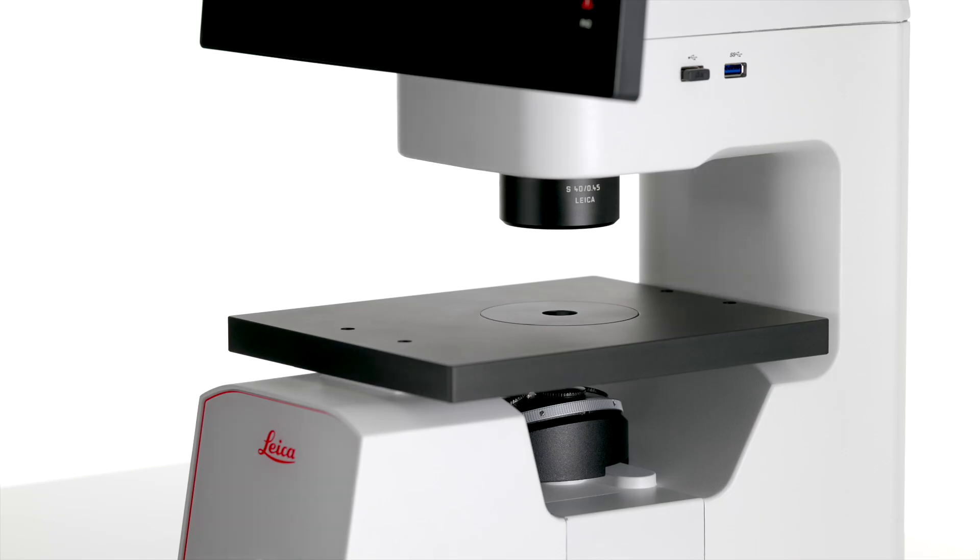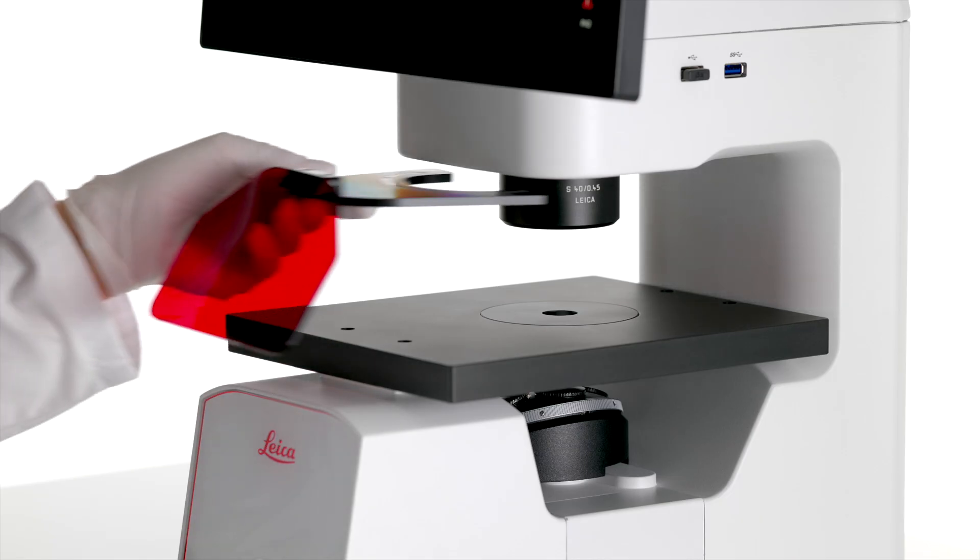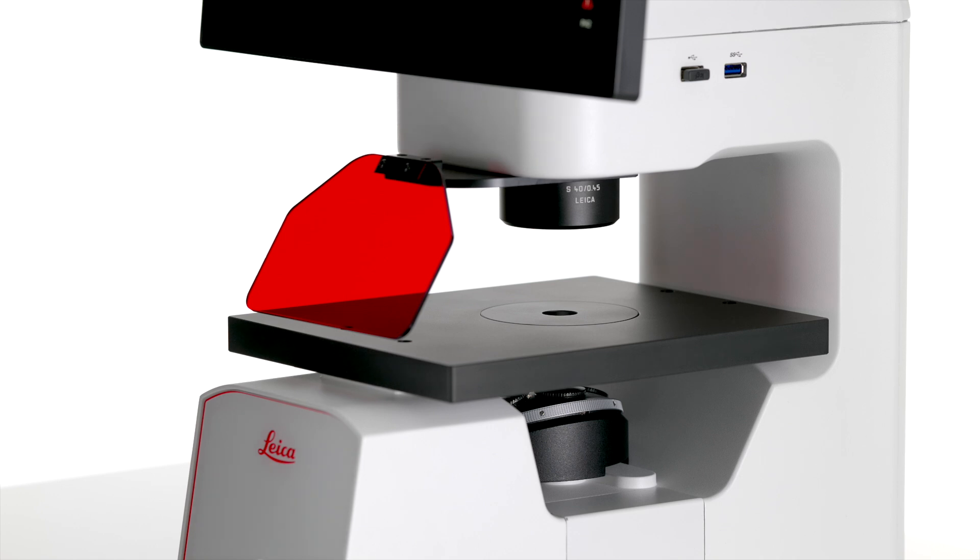The next step will be to attach the UV protection shield by attaching it under the metallic part around the condenser.